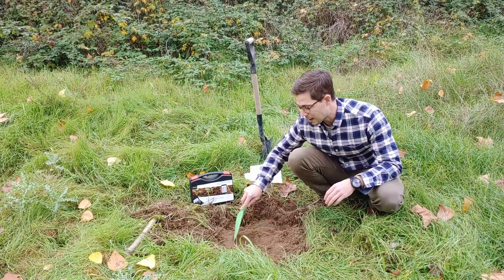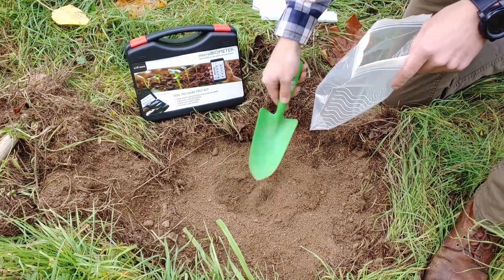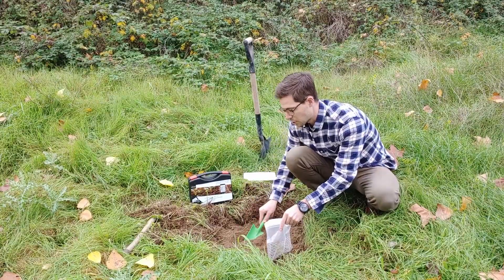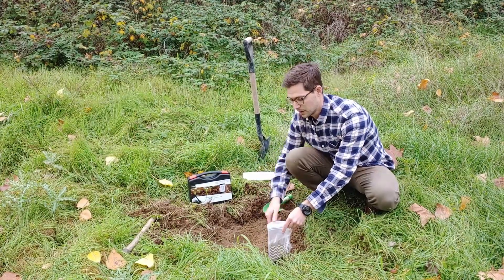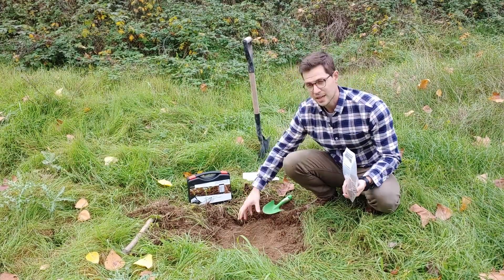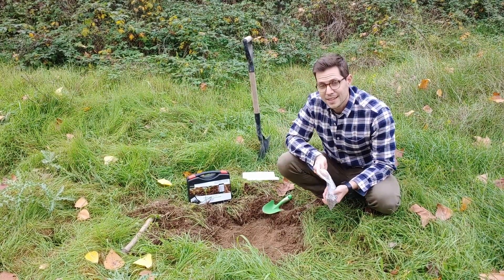I'm trying to get a homogenous mixture, so I'm mixing it a little bit as I go, and I'm going to hold my soil sample in this bag to take back and do the test at home. This is already way more than I need, but it gives me a good sample size for the topsoil on this site.